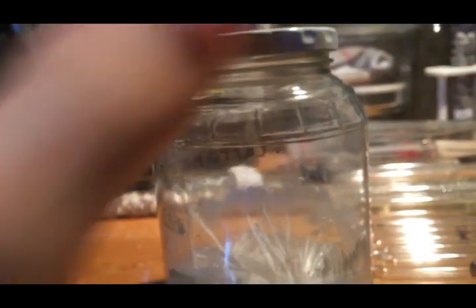Now I said there was one container where the crystals sort of shot out from a cluster — well, this is that container. Look at that — those are beautiful caffeine crystals. And this is the caffeine that you have in your coffee and tea and caffeinated beverages. This is exactly that molecule except in pure form, grown into these big crystals. To think that the stuff that makes you hyper and wakes you up in the morning is actually a white solid that grows fantastic crystals — the famous caffeine forms crystals like that. It's really cool.